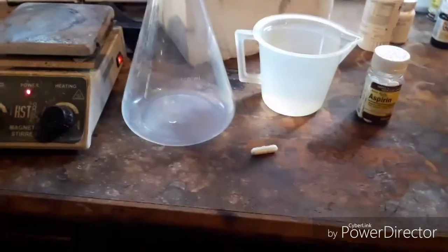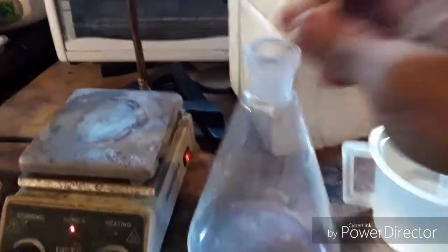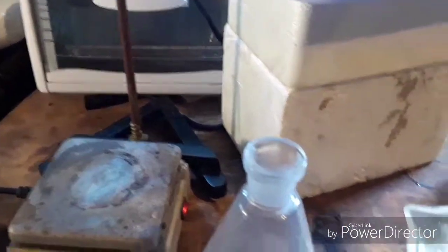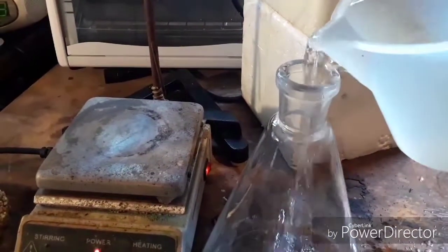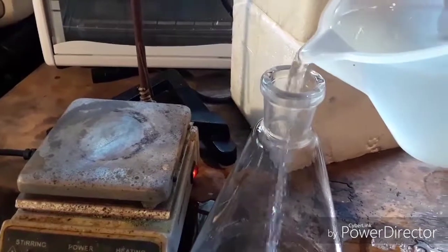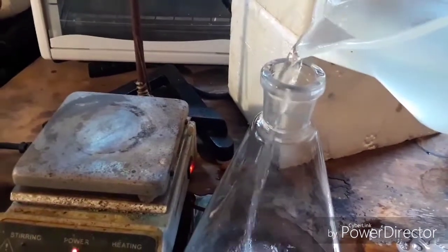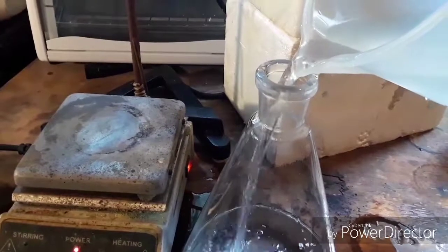Right here I have a 1-liter Erlenmeyer flask with a little stir bar that we are going to be dropping in. We have our hot plate set up here and I am set up for reflux. Let's go ahead and drop our stir bar in there, nice and gently. Make sure you have a nice strong stir bar for this. The next step is to carefully pour in our alcohol. There I go spilling it, because this pitcher sucks. It is a good thing that alcohol evaporates pretty readily since it is highly volatile — it just needs dried up with a little towel and it will evaporate quickly.